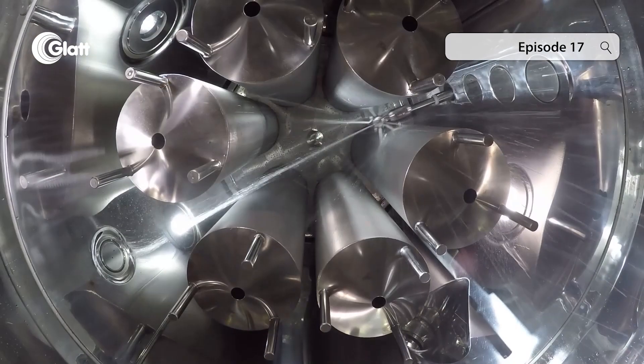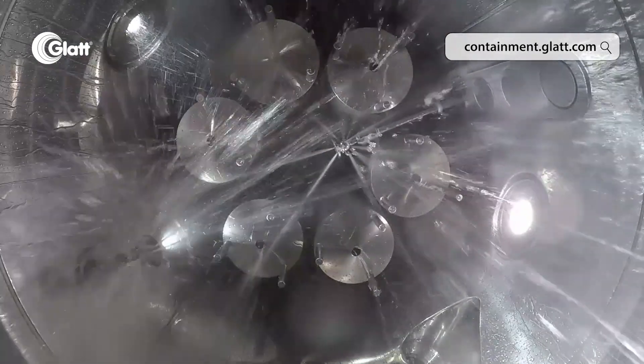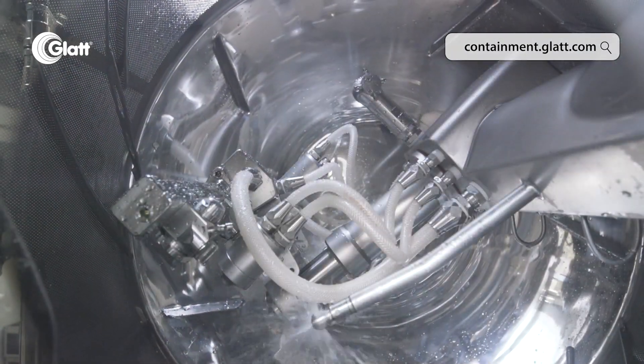Cleaning can be carried out purely manually or fully automatically, and in reality all considerable mixed forms of both also occur. The fully automatic cleaning is CIP — cleaning in place — and the partially automatic cleaning is called WIP — washing in place.